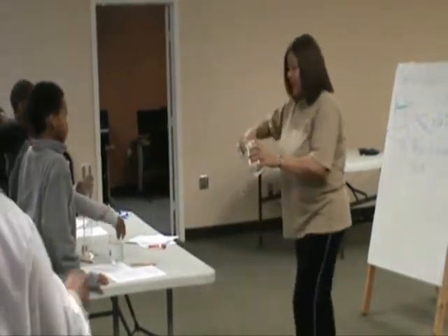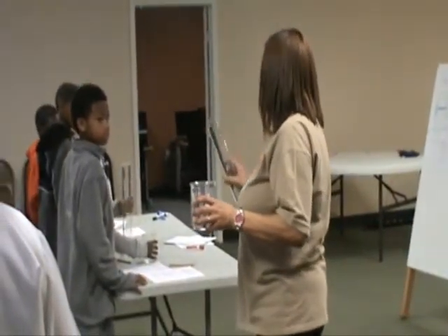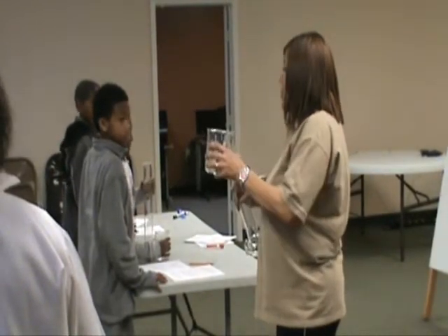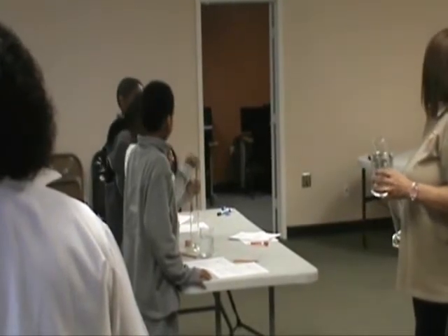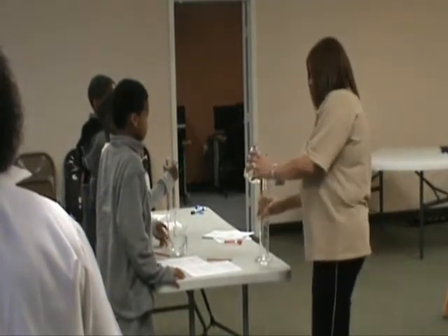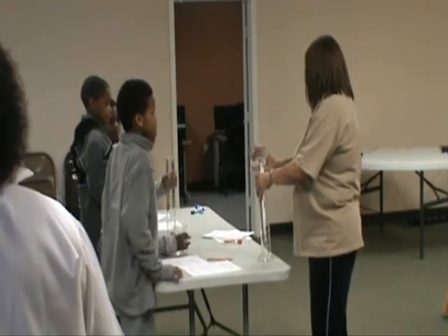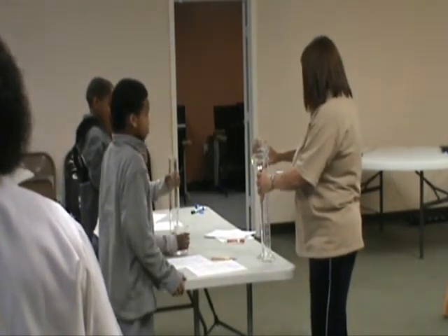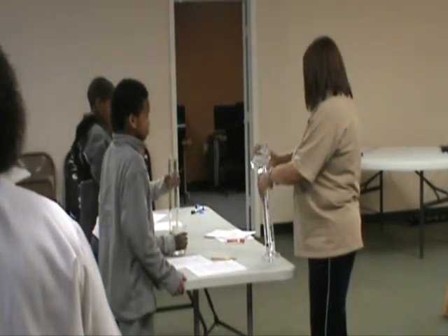For those of you who just got here, we're going to show you very quickly how to fill the graduated cylinder. One of you students that already heard me say this, how should I pour into this cylinder? You should tip this. No, you don't tip the cylinder, you tip the what? The beaker. Well, you can tilt, not tip. You go down the side. And you can actually tilt both, it's okay.